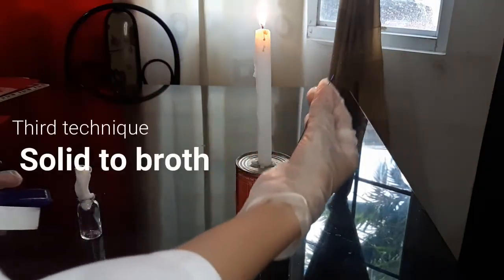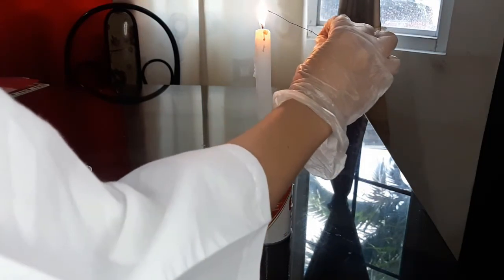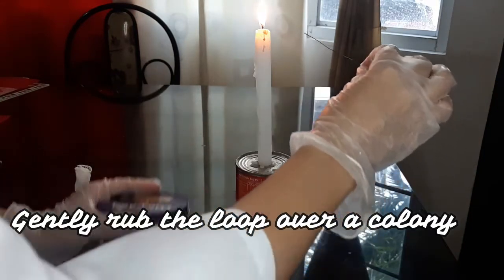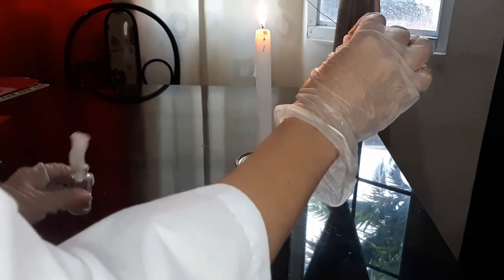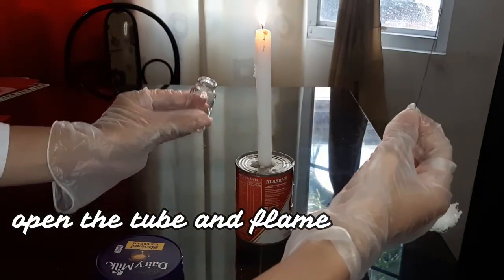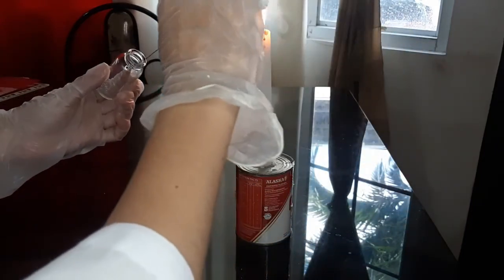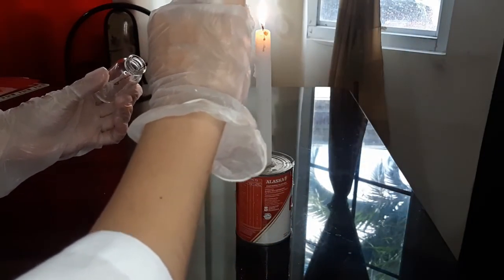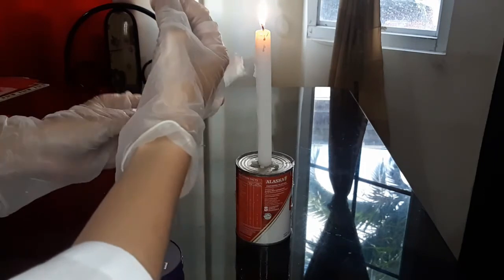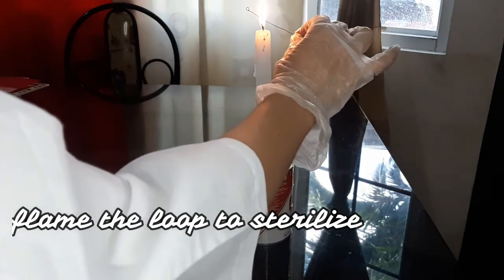The last but not the least, the solid to broth technique. First, flame the loop. Gently rub the loop over a single colony. Remove the cotton plug and flame the test tube. Dip the loop. Flame the tube once more and cover. Flame the loop to sterilize.